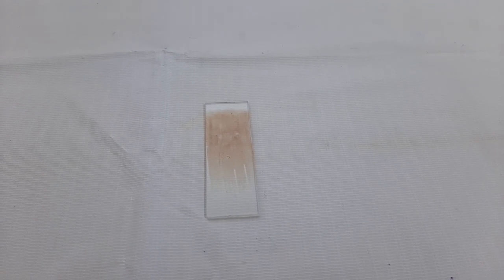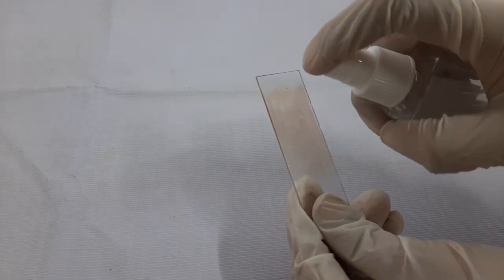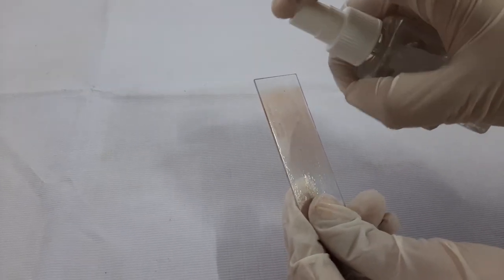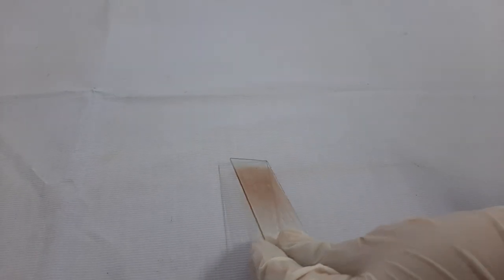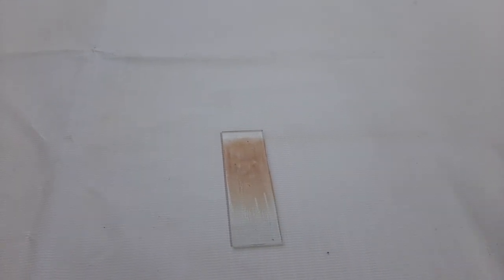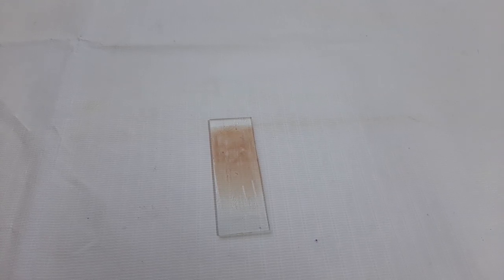The first step of the procedure is to prepare a thin smear. In this video, we have already prepared the thin smear for your reference. The next step is to fix the thin smear using the fixative spray and allowing it to air dry.